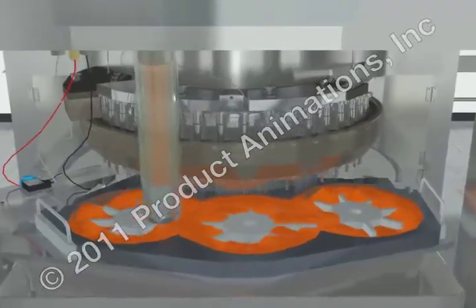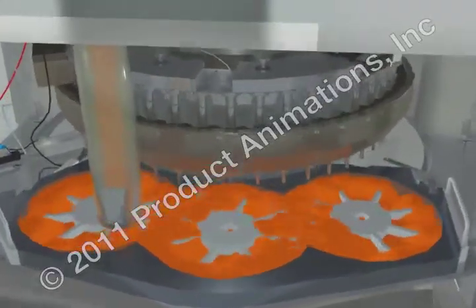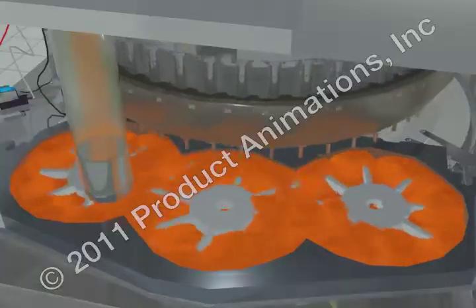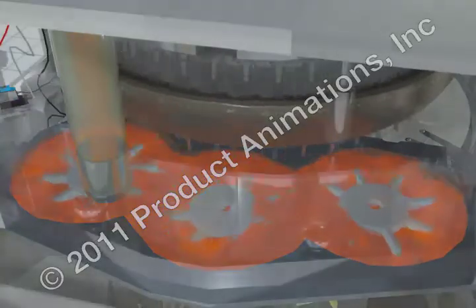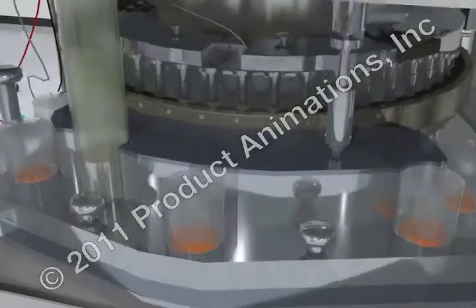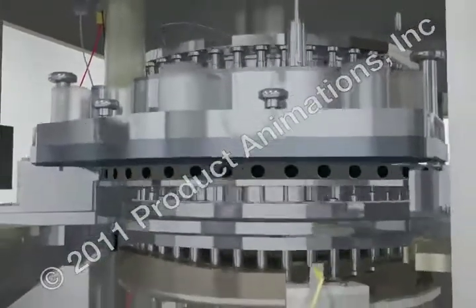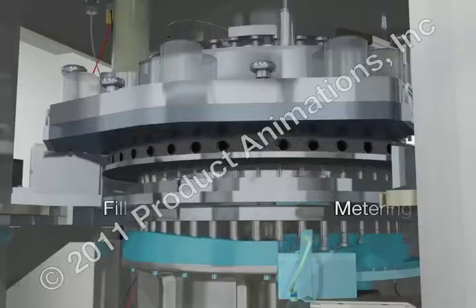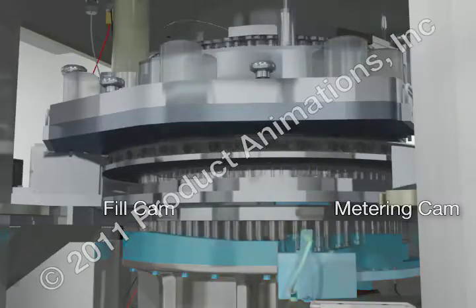The metering stage is the most important part of the tablet making process. During the metering stage, the final tablet weight is determined volumetrically by the fill depth of the die cavity. Metering, also known as dosing, occurs while the dies are still under the feeder.